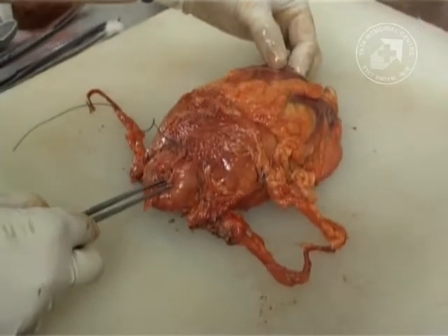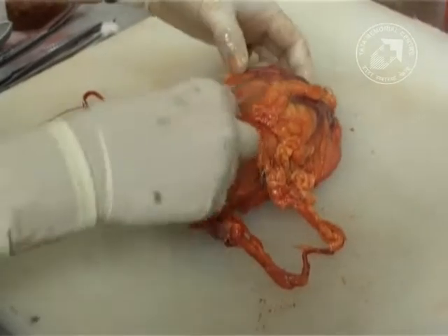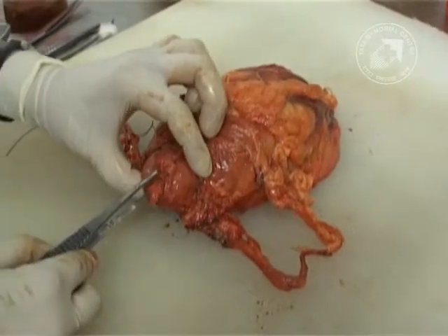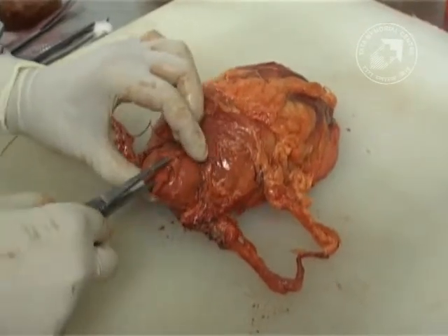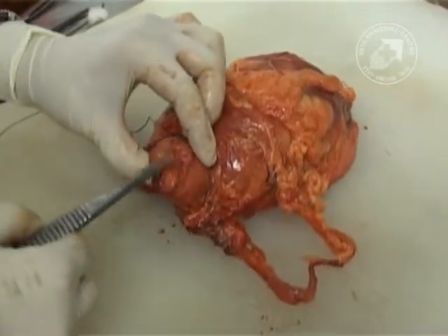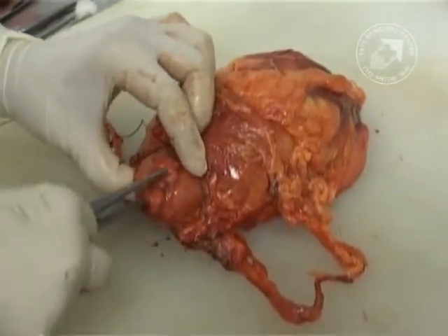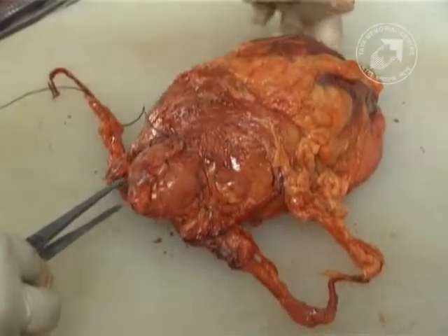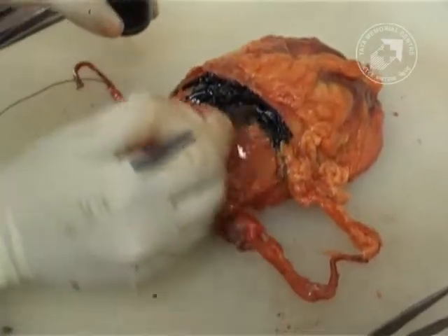This is the anterior aspect which is non-peritonealized. You can see the fatty tissue and the forceps is being introduced into the lumen at the distal urethral cut margin.